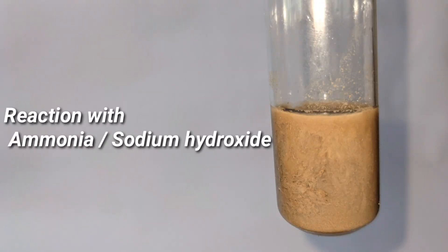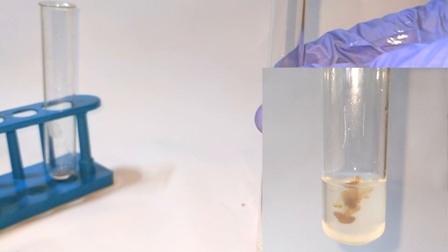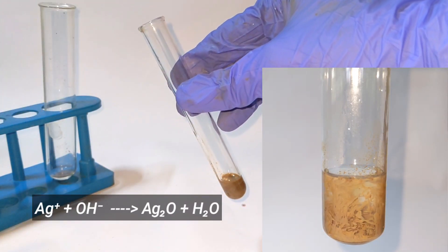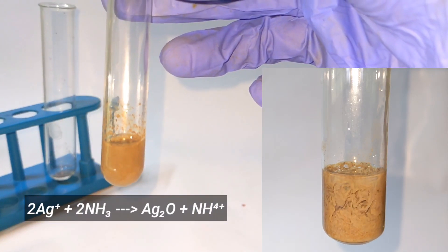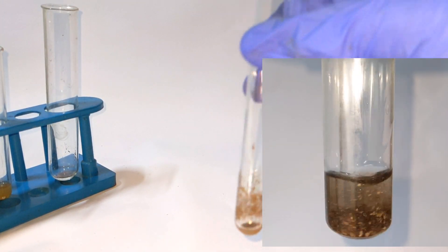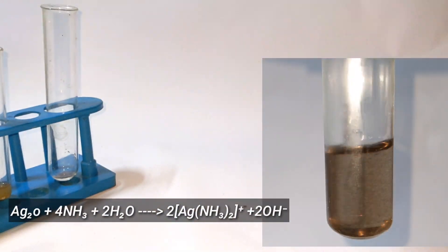Moving on to the reaction with ammonia and sodium hydroxide solution. Both of them give the same result so they are coupled together here. You can see the formation of a brown colored precipitate of silver oxide when sodium hydroxide solution or ammonia solution is added to a solution of silver nitrate. When excess ammonia solution is added to that brown precipitate, it re-dissolves due to the formation of the soluble complex diamine argentum.